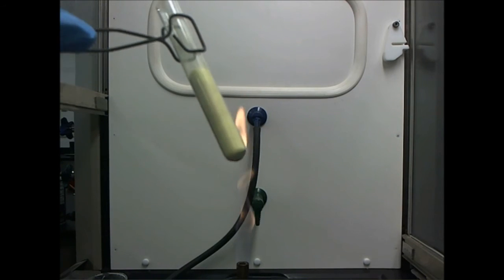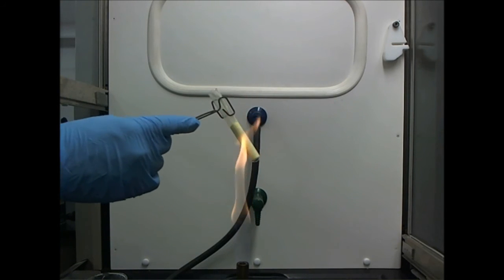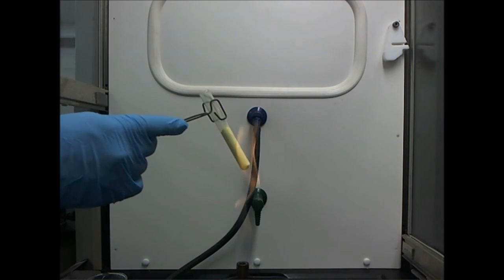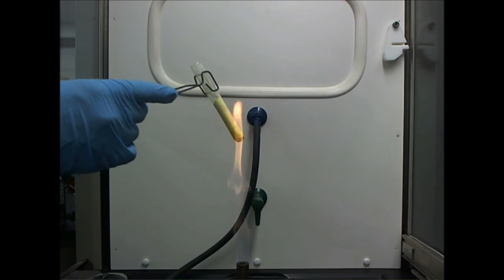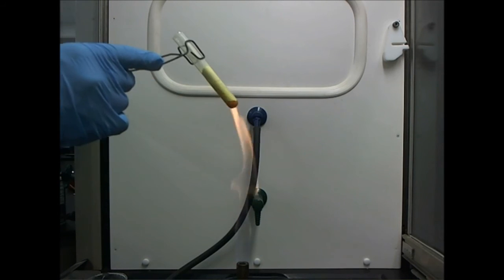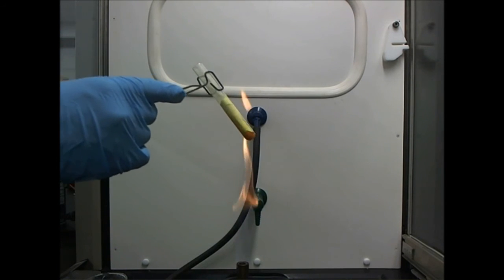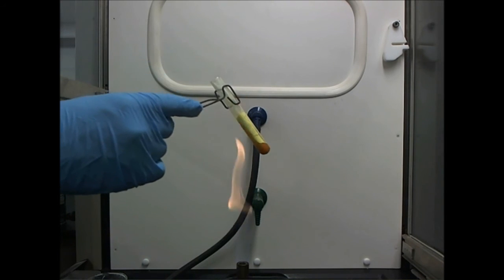In order to break those rings apart, I'm going to have to add some additional energy to the rings. And I'm going to do that over this low temperature fire. So here I'm adding energy to the sulfur, and we're going to see what happens to it as I add energy. Is it indeed going to change to a different allotrope of sulfur? Are its properties going to change even though it's made up of the same atoms?